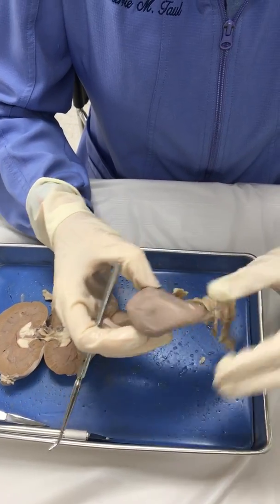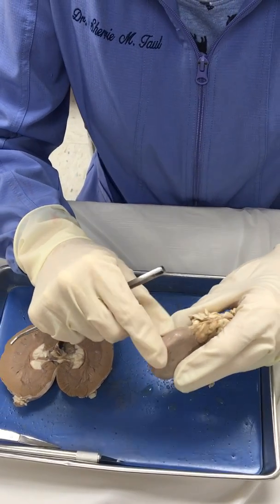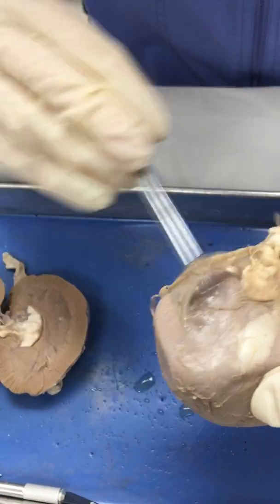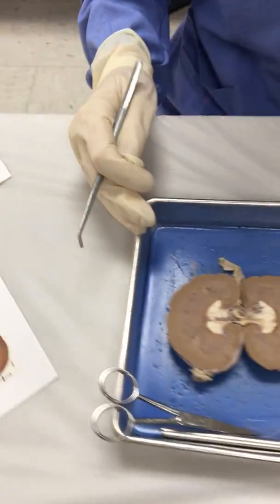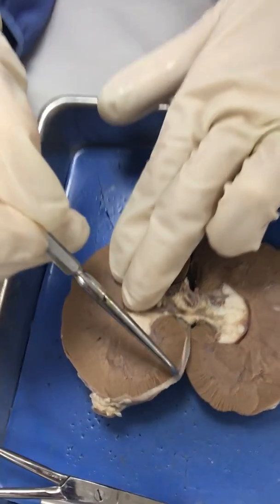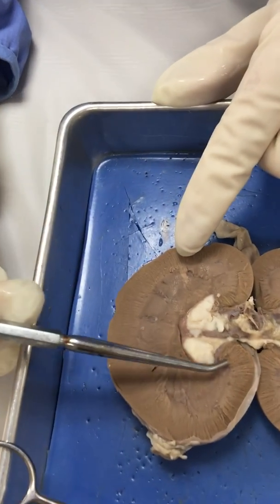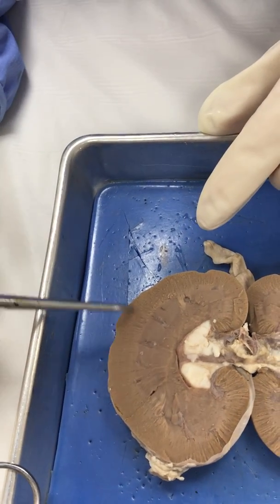That is about what you can see on the exterior. This one has a thin fibrous capsule, but we have the fibrous capsule around the kidney — this tough capsule that we see going around it. On the one that I've opened up, you can probably see the capsule a little bit better where I pull it away. You can see what a thick capsule there is around the kidney. On the section that we have cut in half, you can sort of see this little fanned-out area all the way around the kidney.